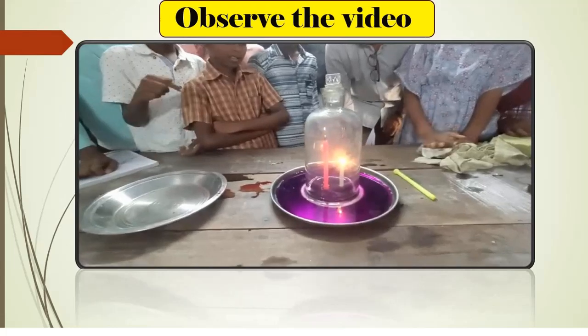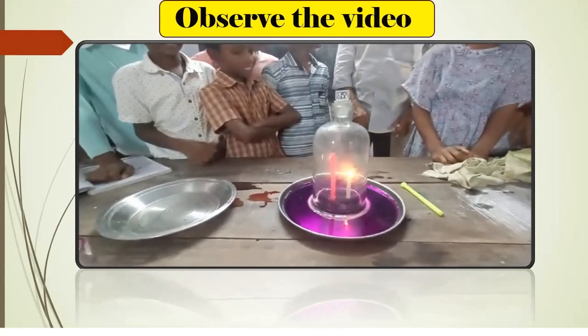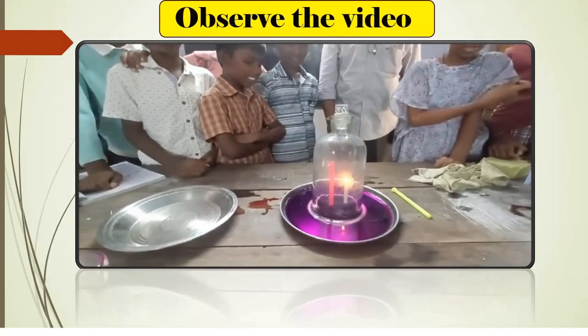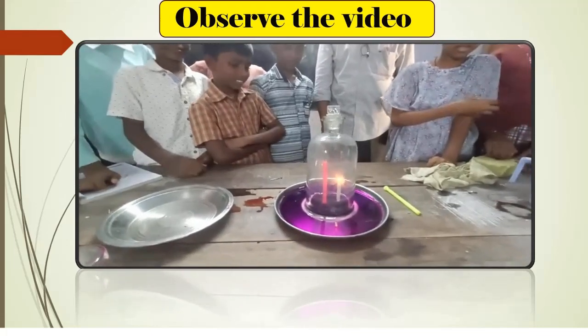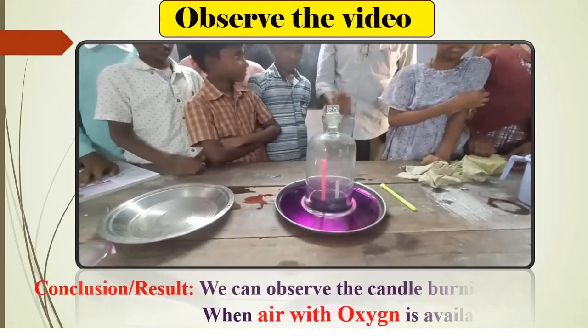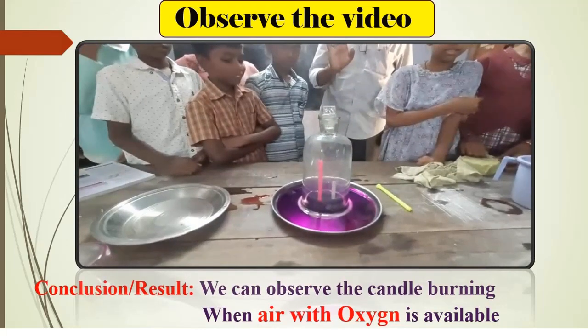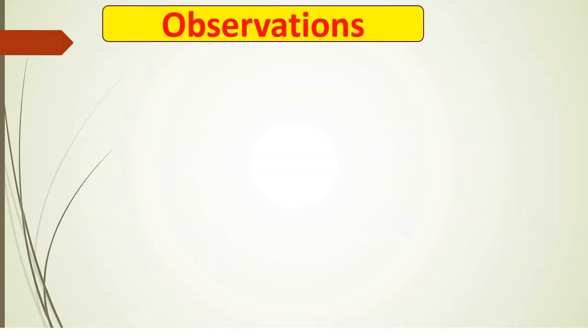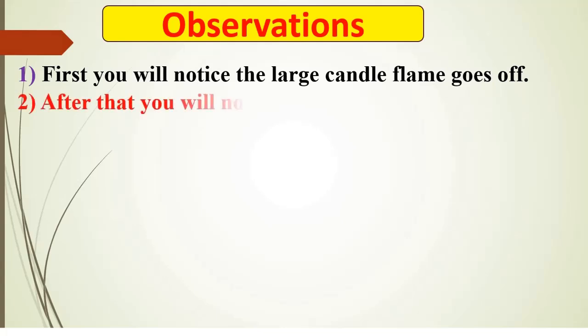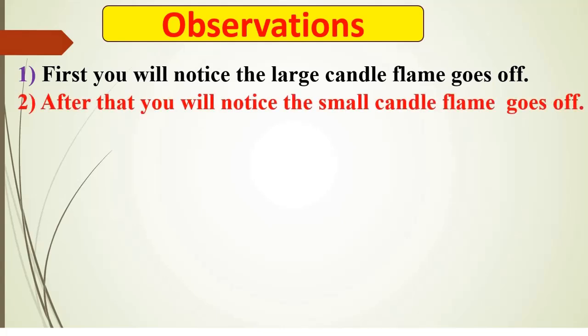Some water also comes inside the beaker. So from this activity we can observe that the candle burns when air is available. First you will notice that the large candle flame goes off. After that you will notice the small candle flame goes off.